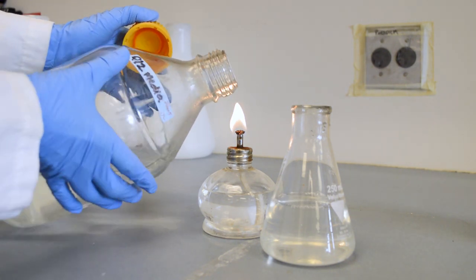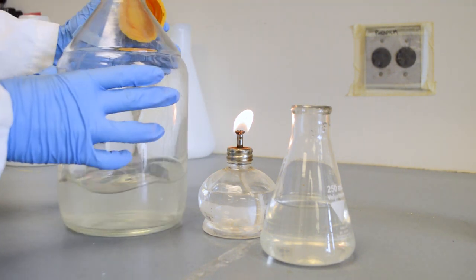As soon as you are finished, flame the mouth of the media bottle again, cap it, and set it aside. Now your new flask is ready to be inoculated.